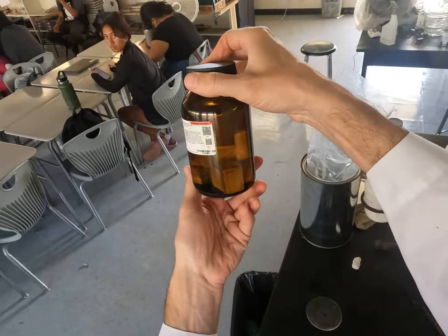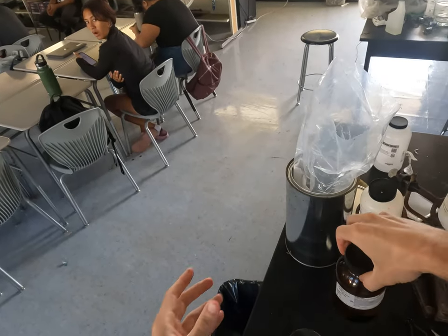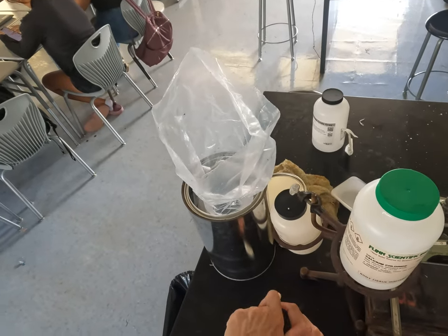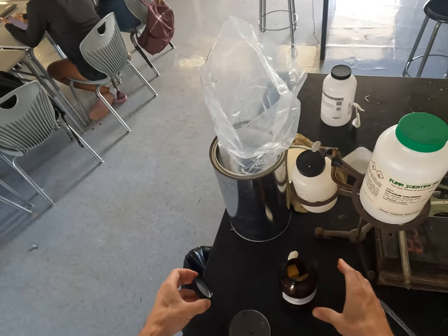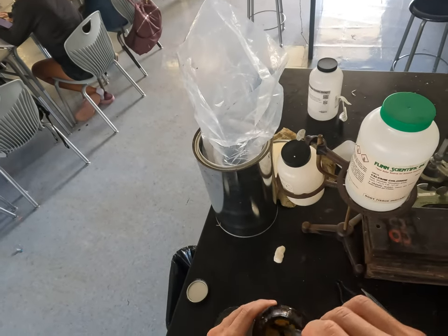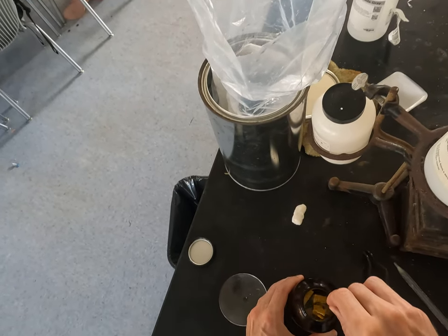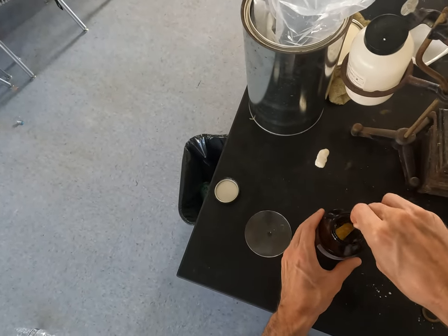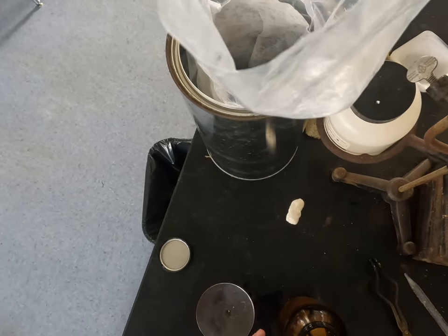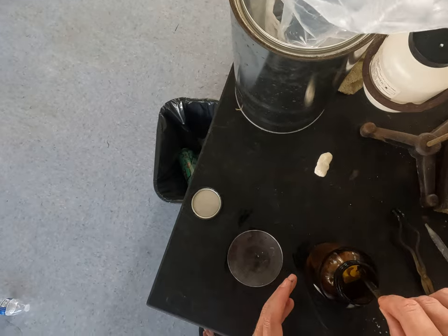So I have here sodium metal. It's in a jar inside a bag inside a can for safety. And we're going to see what happens when we cut a chunk off of the sodium metal, which is also quite soft.